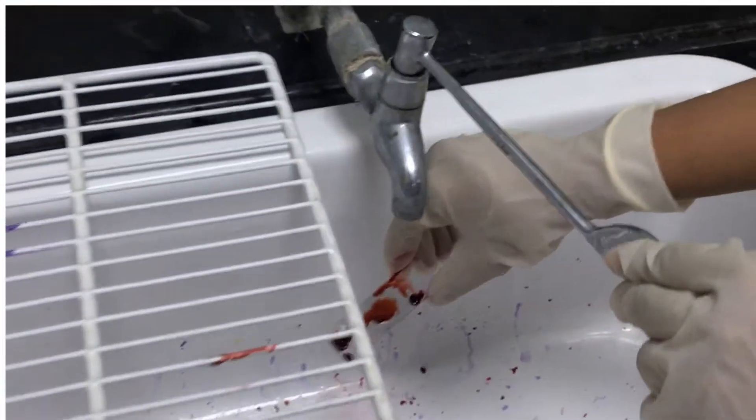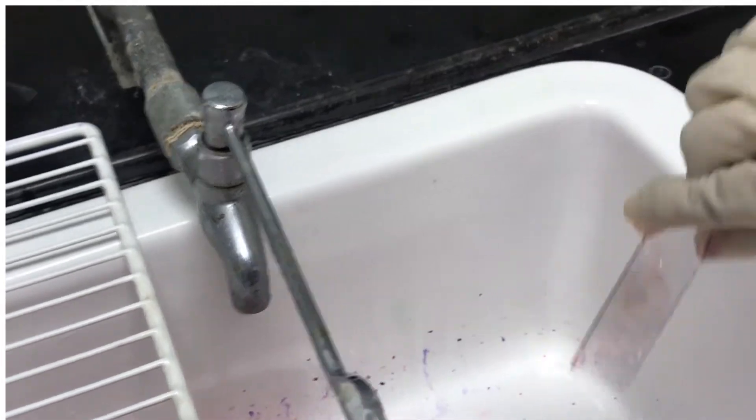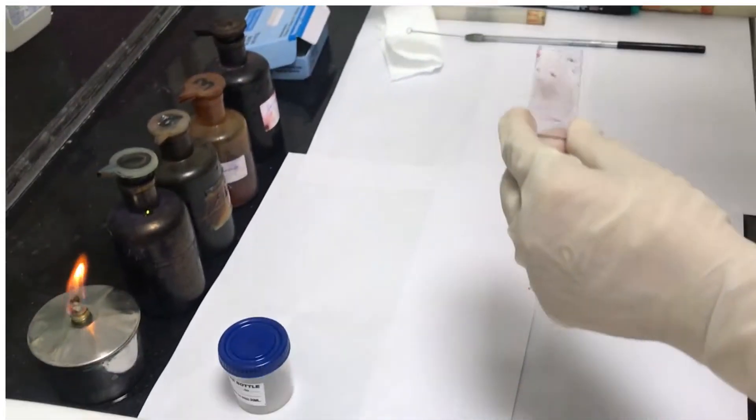Tilt the slide and rinse with tap water. Now blot dry the slide with the help of blotting paper.